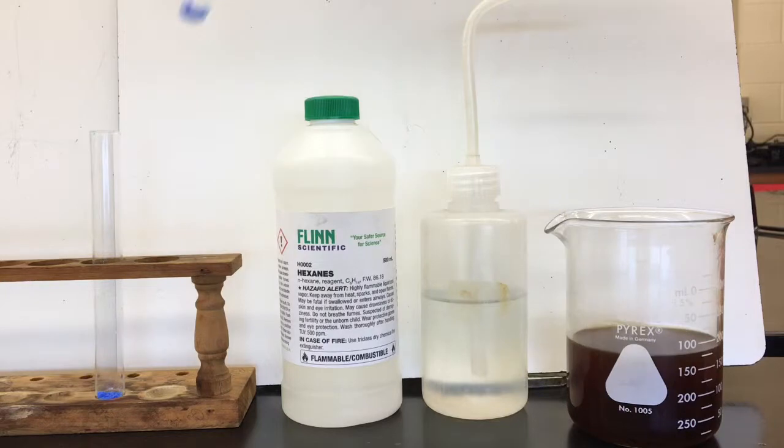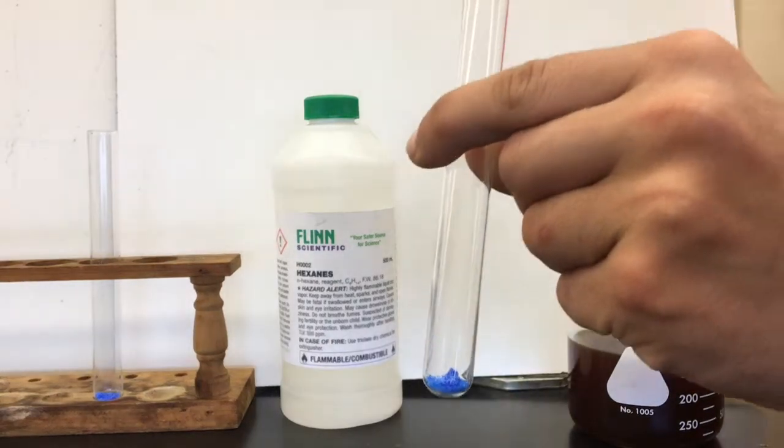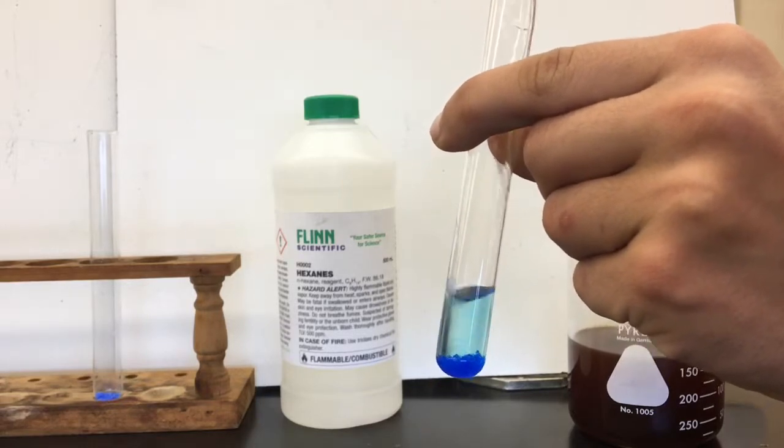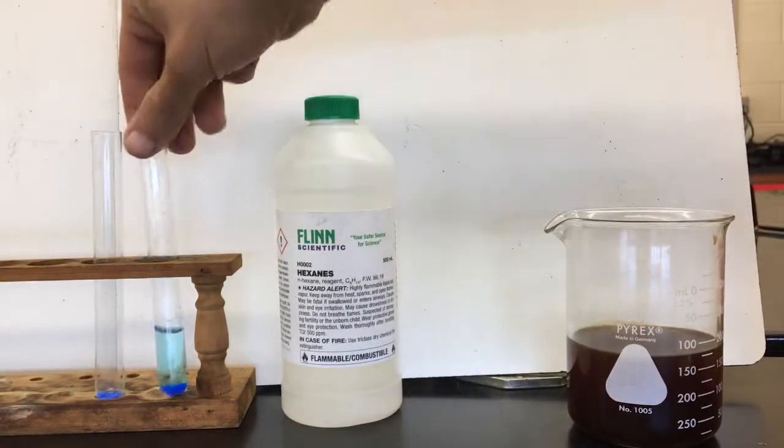Let's start with the water. We'll get out our copper nitrate and we'll get our water squirt bottle, and we'll add a little bit of water to this guy. Neat. And I'm actually just going to return that to the test tube rack for a second, let it sit.